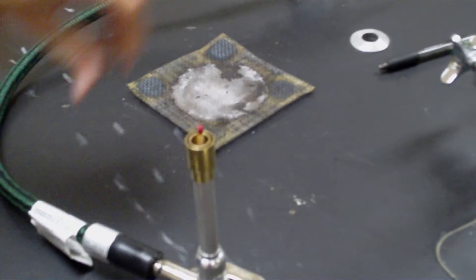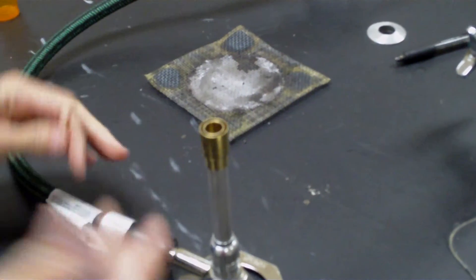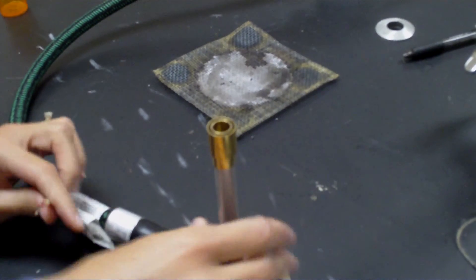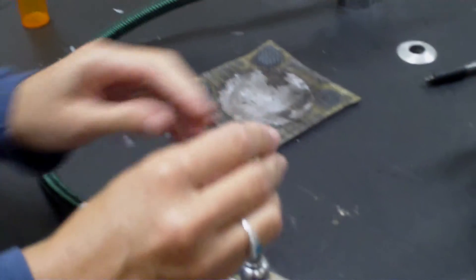All right, so when you have trouble lighting it, in this case you hear the swishing sound. It probably has too much oxygen, so I'm going to crank that down a little bit and try again.